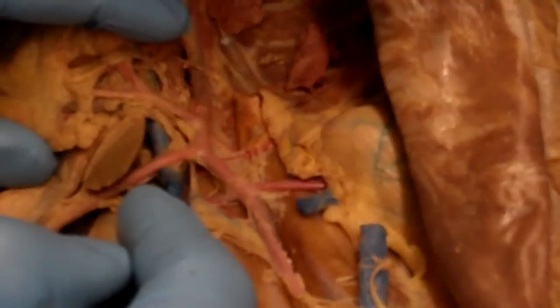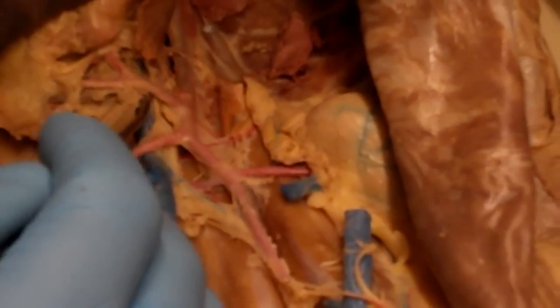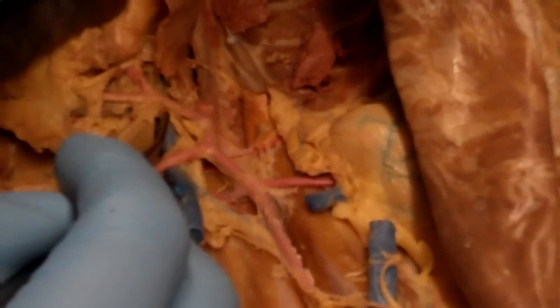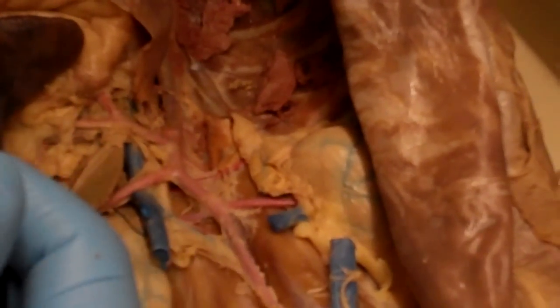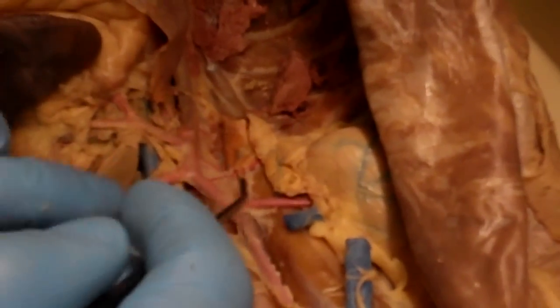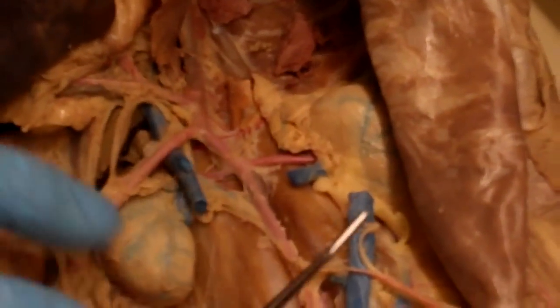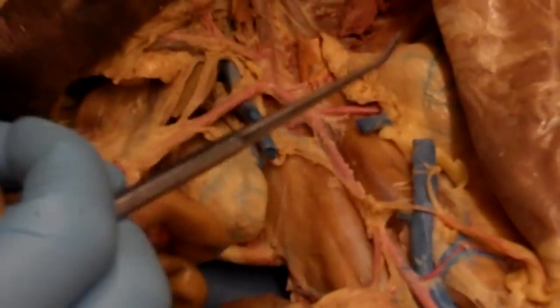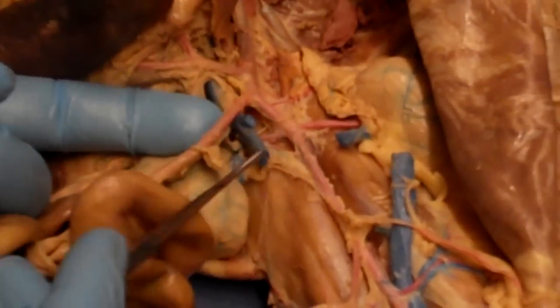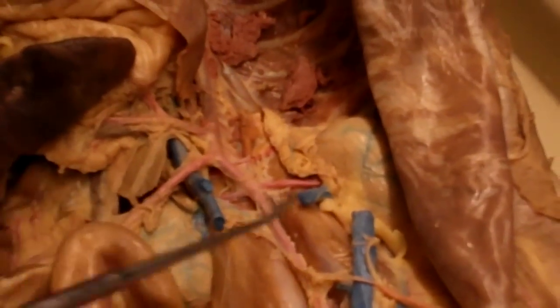It's just one vessel. The next branch is going to be the superior mesenteric. And so whereas the celiac artery did the stomach, the next sort of portion of the GI tract is going to be the small intestine. So we're talking the duodenum, the jejunum, and the ileum. And you can see if we look at the superior mesenteric artery and I pull on the mass of the small intestine, you can see how it follows it wherever I go. So that's going to be the superior mesenteric, which is doing primarily the small intestine.